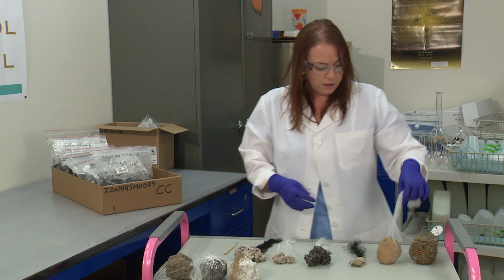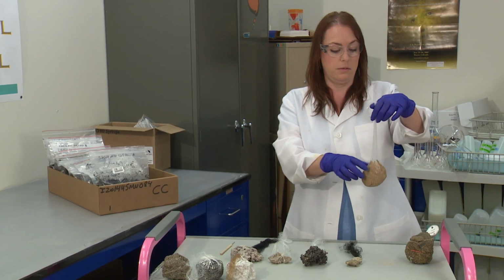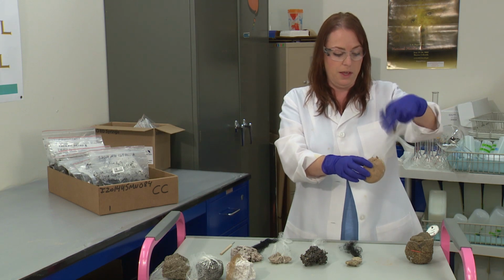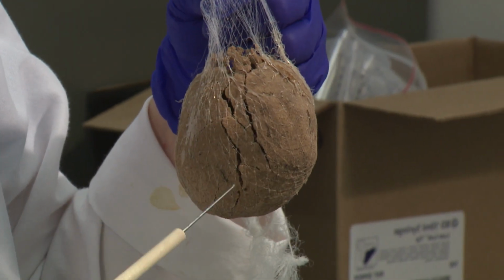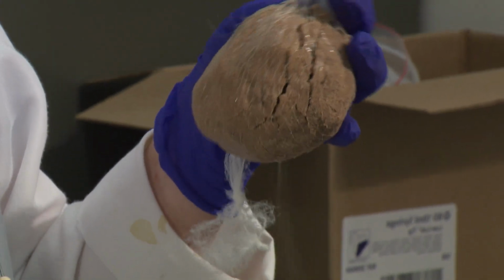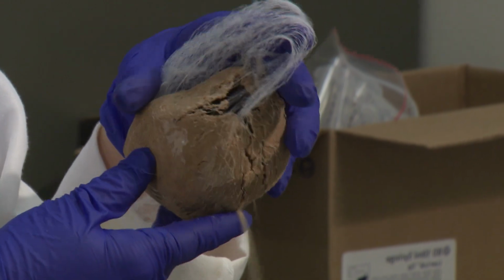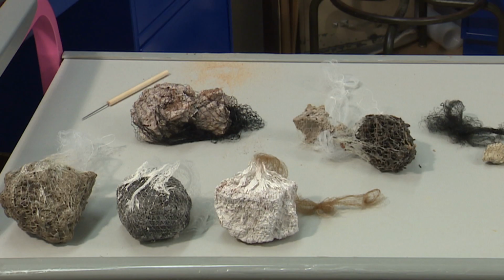Here's a clod that has come in that's a sandy texture, and the clod probably looked fine in the field, but when it was transported, it broke in the box, and then we kind of have it just spill out because the clod has broken, that saran on the outside, and all the soil inside is disturbed, and we can't use this clod.